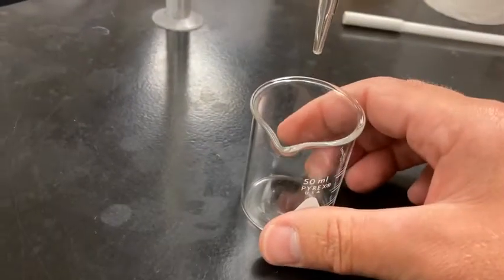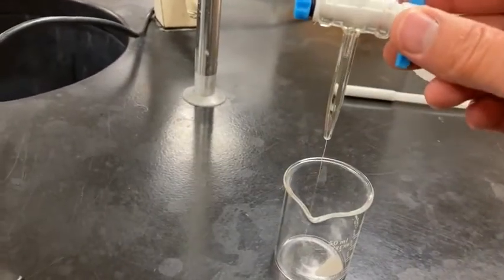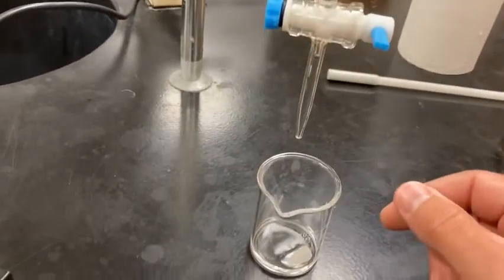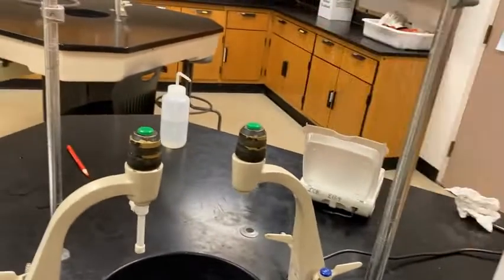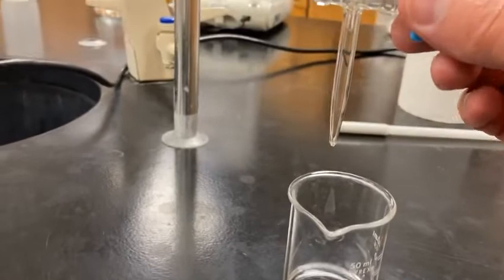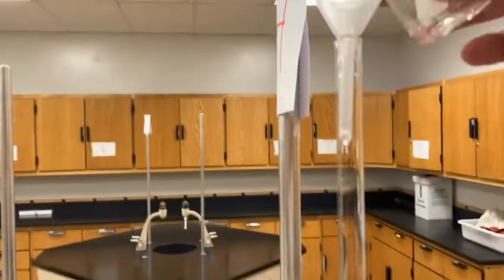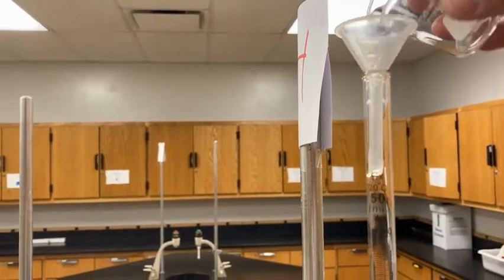So to do that, I got a little beaker underneath. I'm just going to open up the valve. I'm getting rid of the air bubble that's basically in here. Okay. You could also do a little jiggity jag where you kind of open it up and you do a little shake into the sink, and that'll get rid of the air bubble that is in the tip of our burette. Okay. Anything that's come out into this beaker, we can just add back up into the burette at the top because it hasn't reacted and it was a clean beaker.